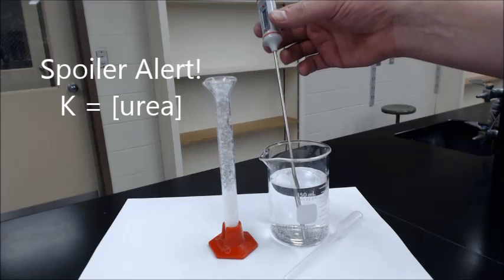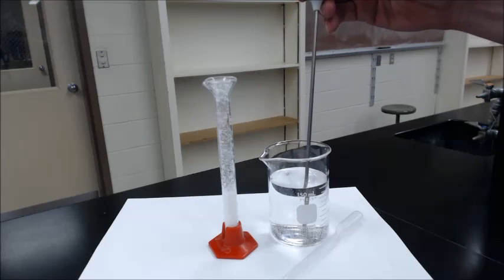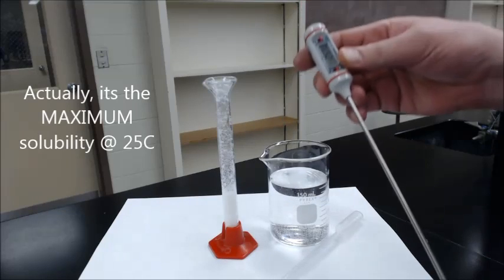Okay, we're going to try to figure out the concentration of urea at 25 degrees in some water. So I've got some DI water here, and let's see what the temperature is.